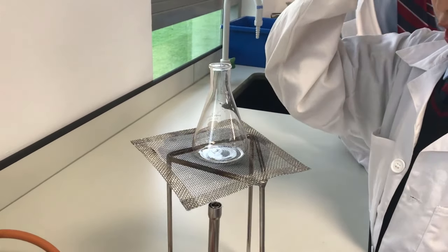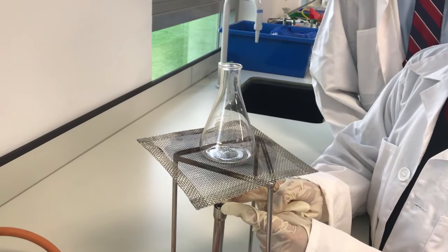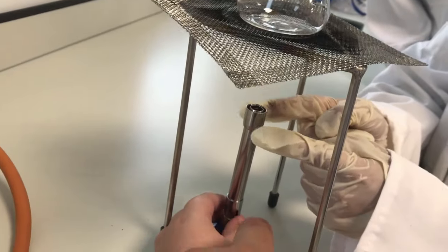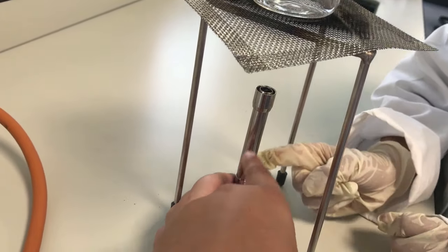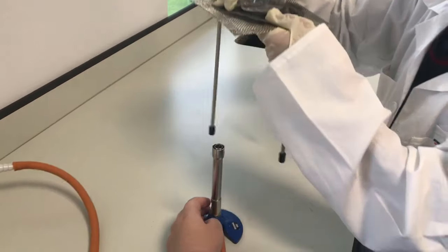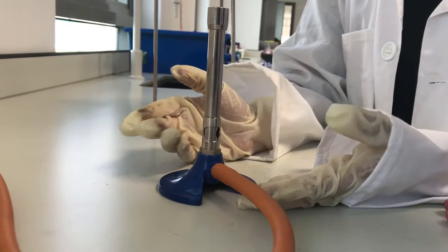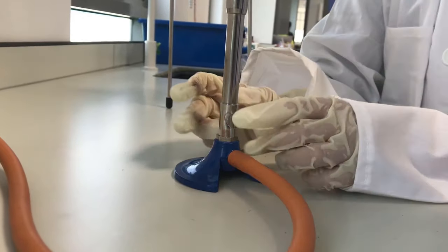And then you can change the heat. You can change the heat from here until your partner or whoever you're working with, oh yeah, hands are off. You're not allowed to touch this. Yeah, you have to control it from down here. I believe it's only from here and up you're not, yeah, you only. Don't worry, guys, let's move this away and I want to show you this thing is never going to get hot. It might get warm but it's never going to get hot because this is away from that metal piece.